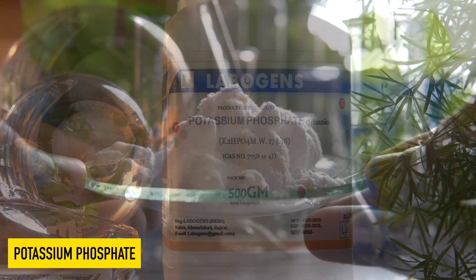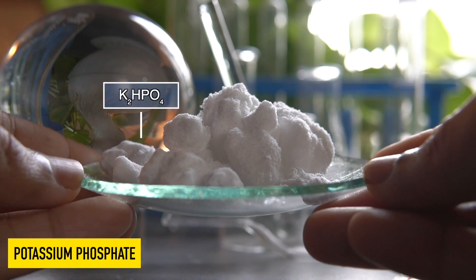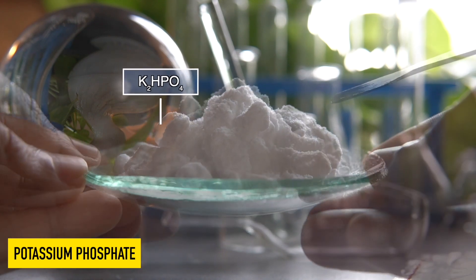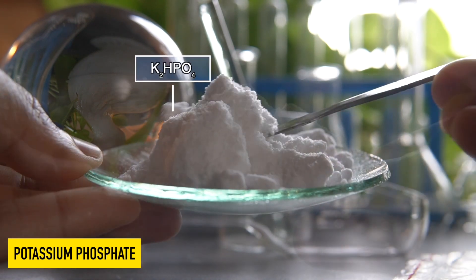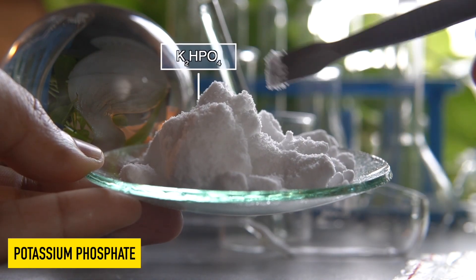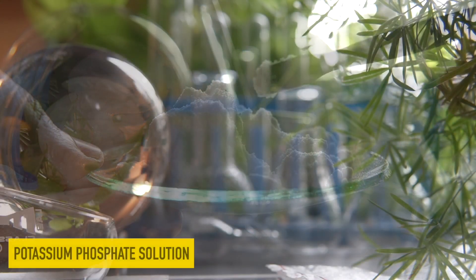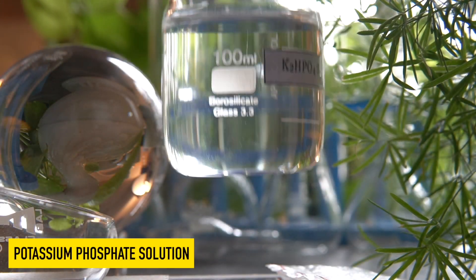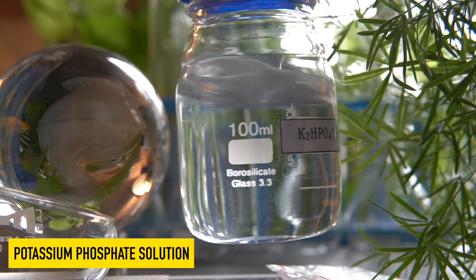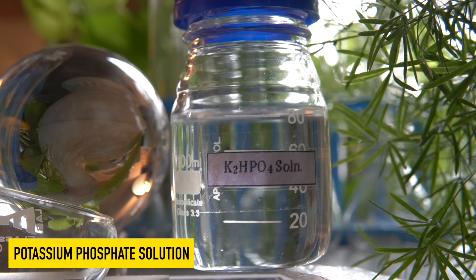This is dipotassium hydrogen phosphate. Dipotassium hydrogen phosphate is a white crystalline solid and it can also dissolve very easily in water to make a clear solution.